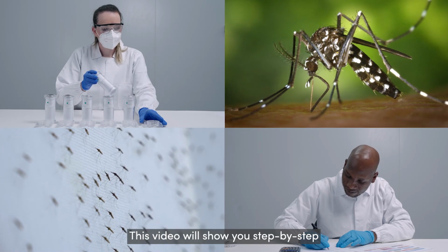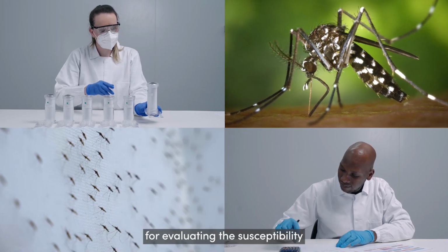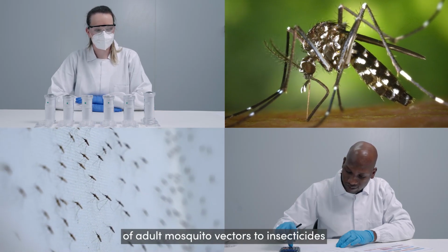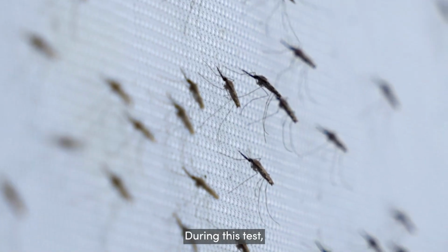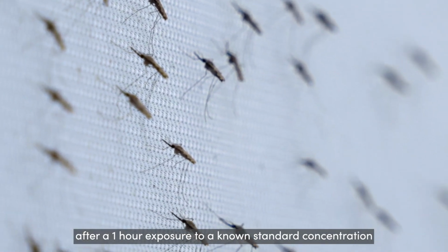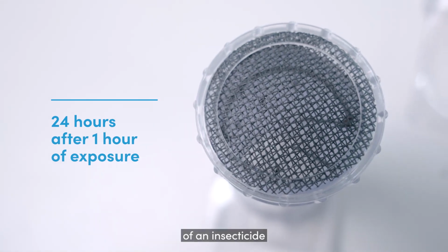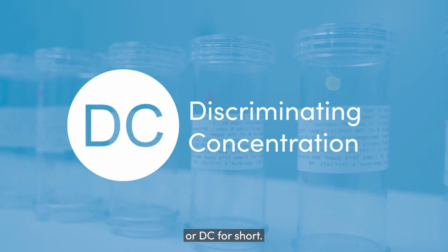This video will show you step-by-step how to conduct the standard operating procedure for evaluating the susceptibility of adult mosquito vectors to insecticides using the WHO tube test. During this test, the mortality of mosquitoes is recorded 24 hours after a 1-hour exposure to a known standard concentration of an insecticide, called a discriminating concentration, or DC for short.